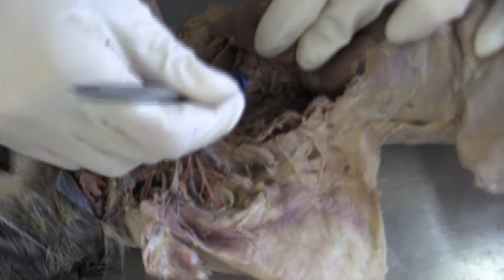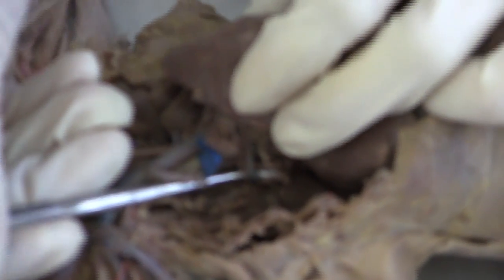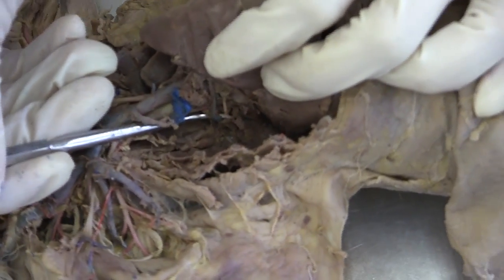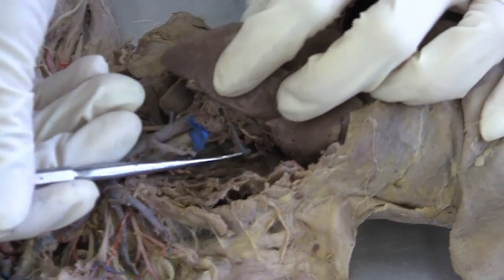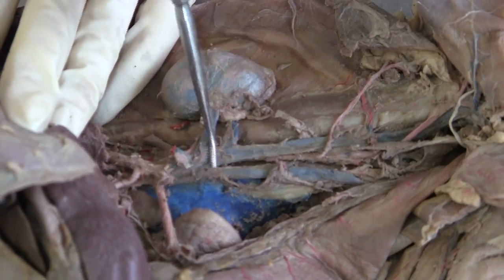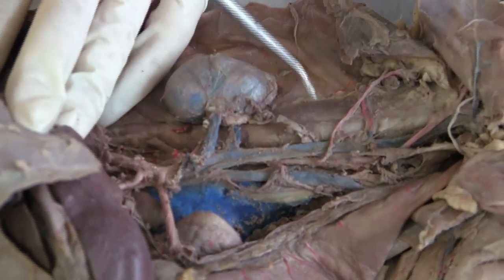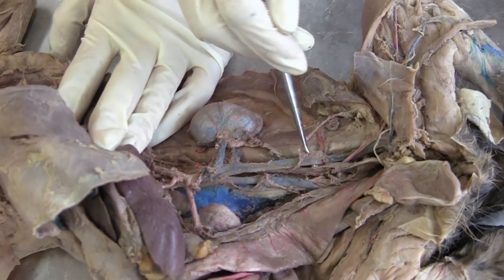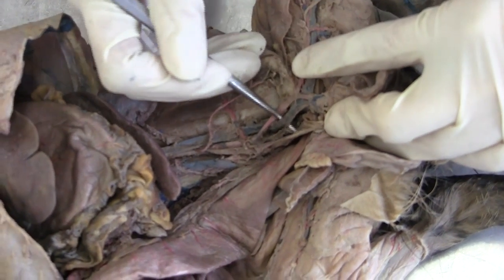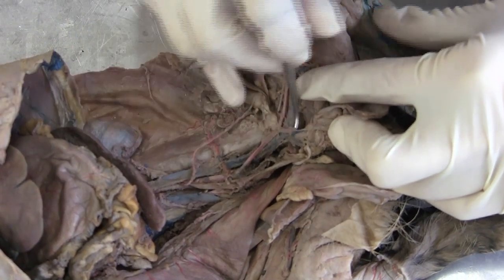Right behind the heart, the blue stuff here — this is the azygos vein. And the renal vein is the same here — it's actually from the kidney. And the common iliac vein: so here it's the inferior vena cava, and then they branch into two. So this part here is the common iliac vein, this part is the external iliac vein, and the internal iliac vein is here. Femoral vein here.